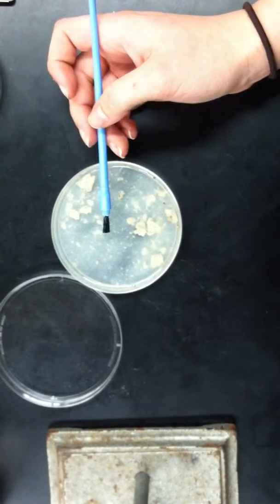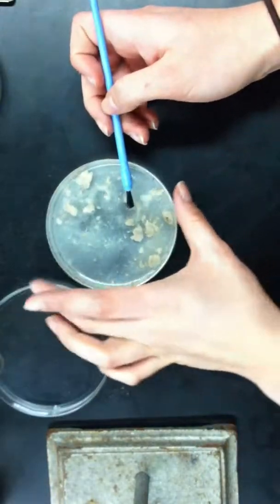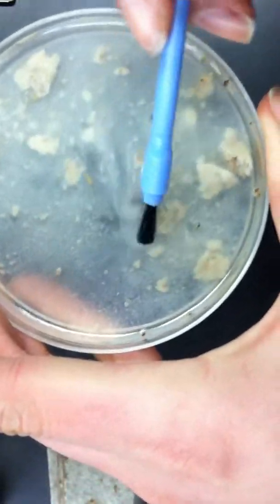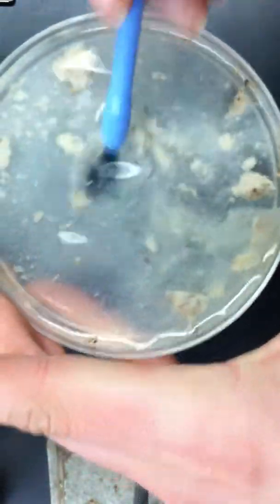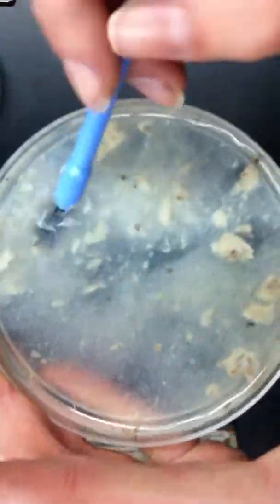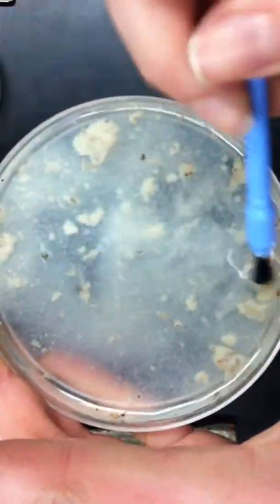I don't know if you can zoom. I can't. Okay. I'll pull it up. The larva here are now floating to the top, if you can see them. So it's easier to pick out. You want to mash up all the clumps to make it easier so they all come out.